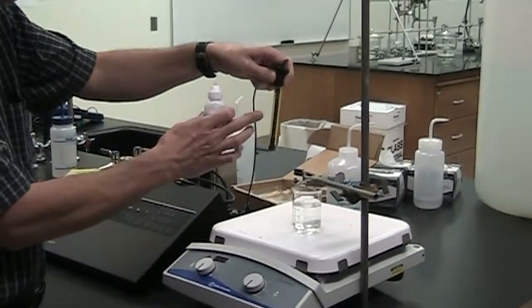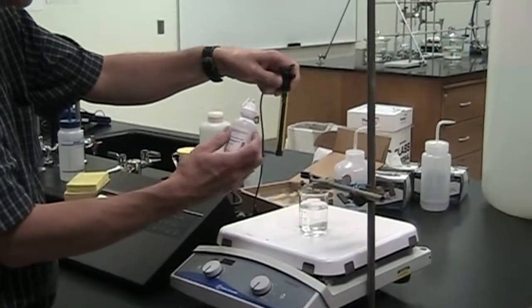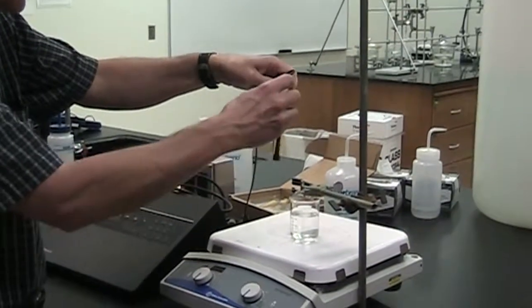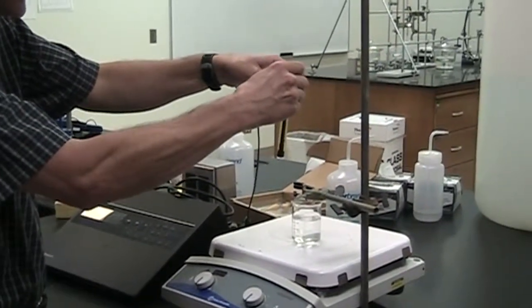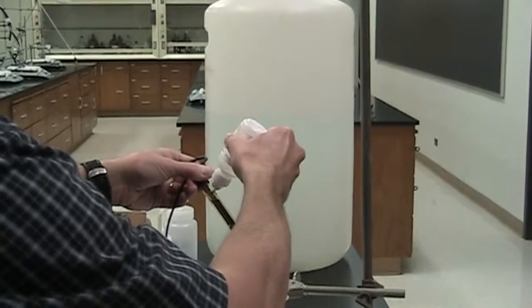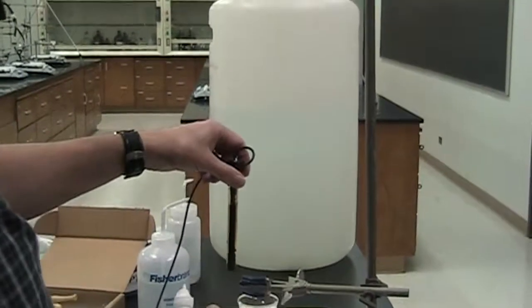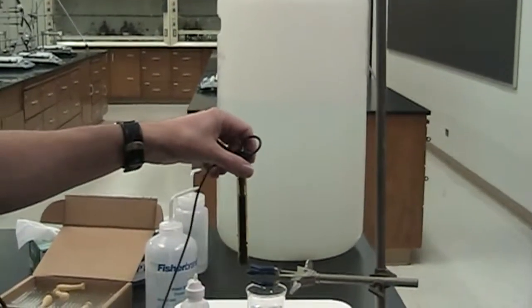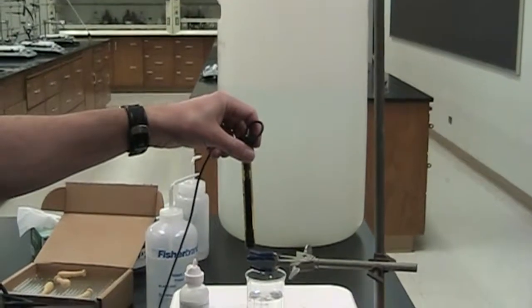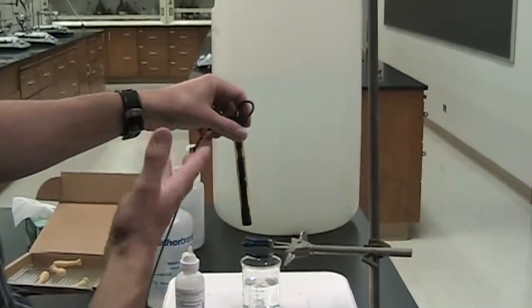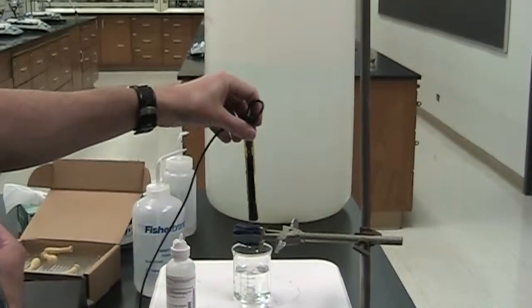So you want to check. If it's been filled recently, it might only be down a little. You can always top it off. It never hurts. The bottle goes in, squeeze them, and you can see the filling solution up to near the level of the hole. That's as far as you can fill it anyway. You should check that every time before you start to use the electrode.